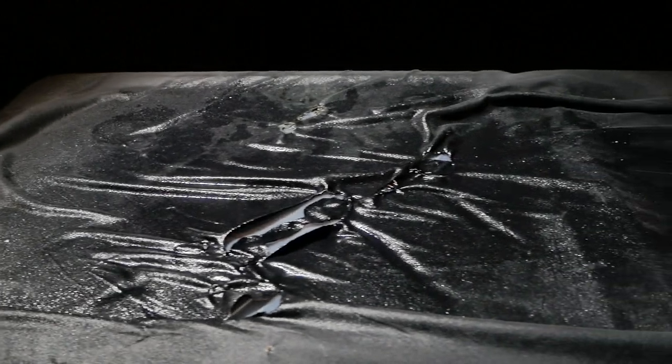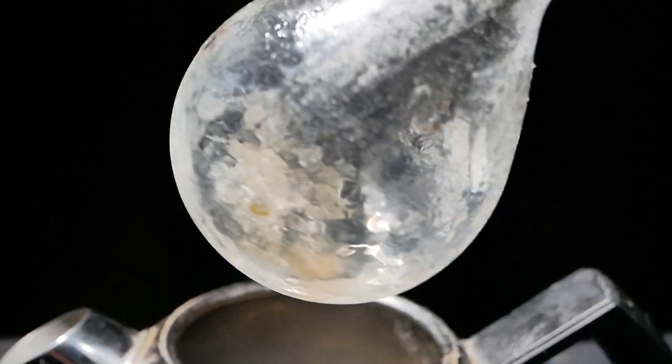Well there goes another perfectly good background. Back to the experiment. It's all gone and we're left with the glycerin which has a consistency of shitty playdoh.